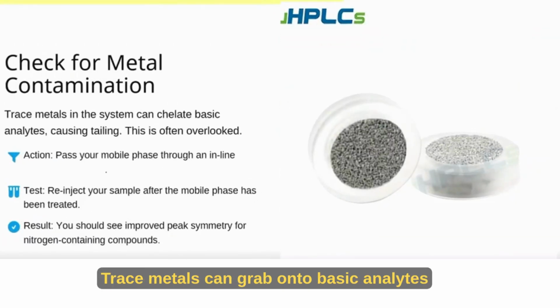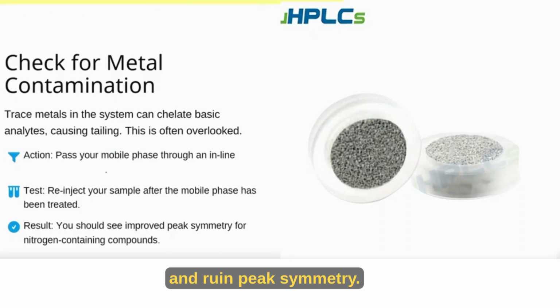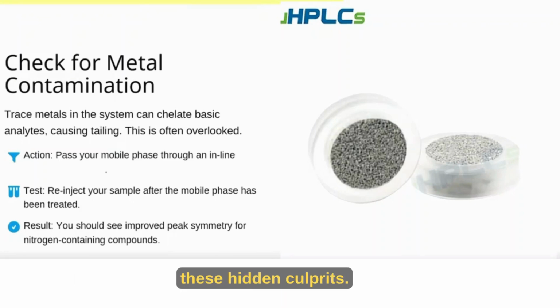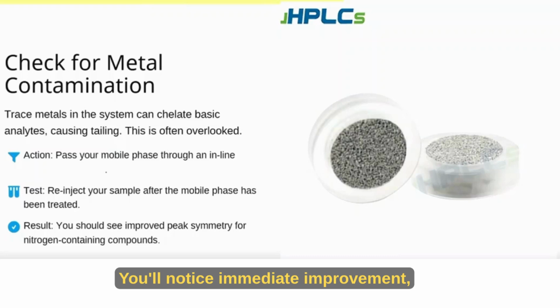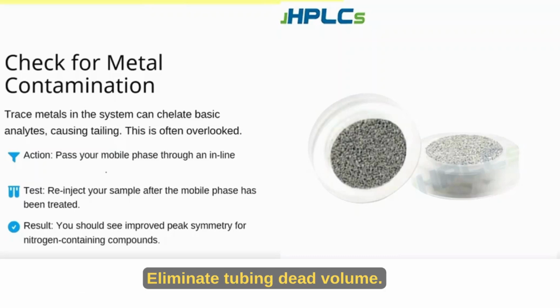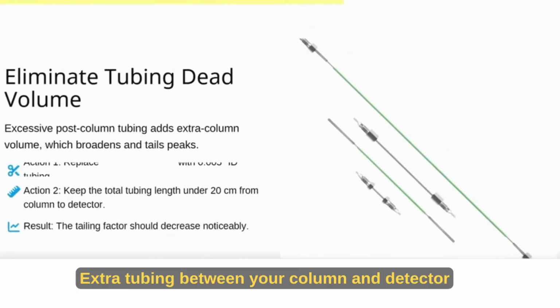Check for metal contamination. Trace metals can grab onto basic analytes and ruin peak symmetry. Running your mobile phase through a chelating cartridge removes these hidden culprits. You'll notice immediate improvement, especially with nitrogen-containing compounds.